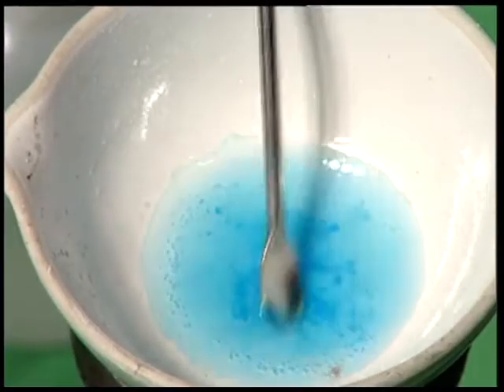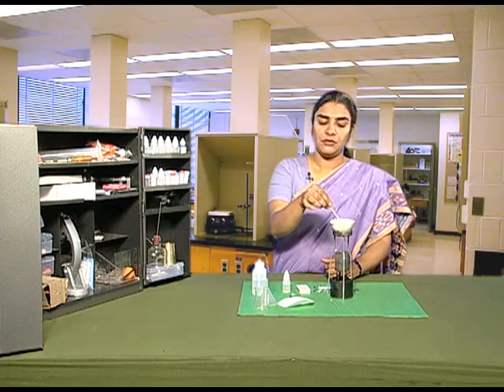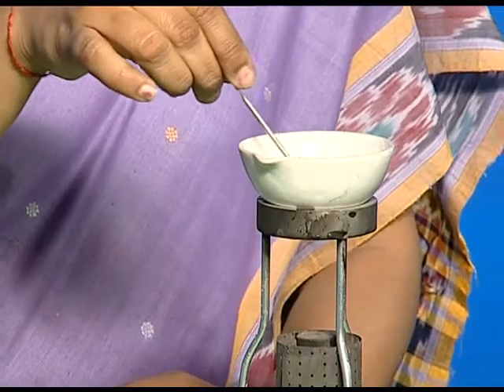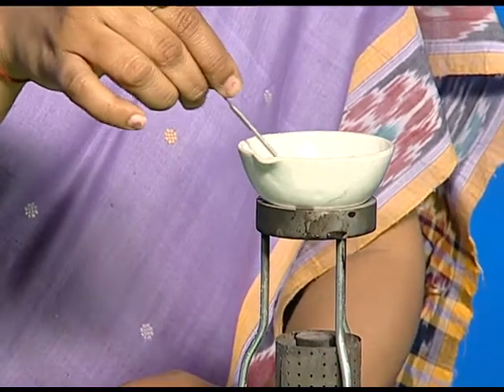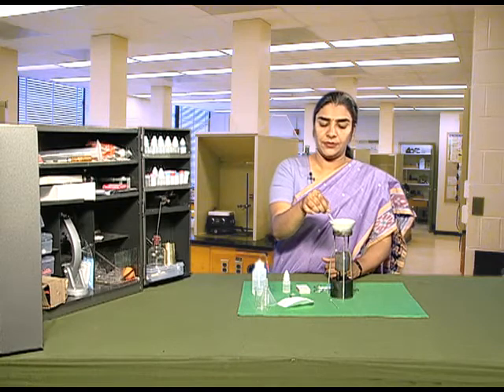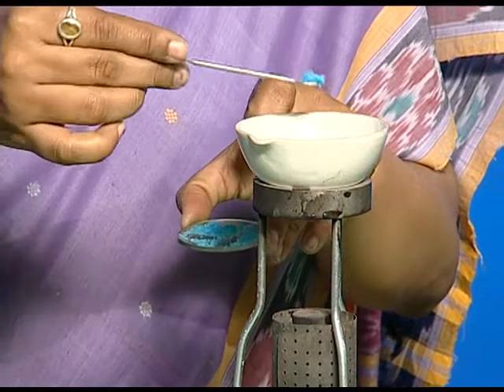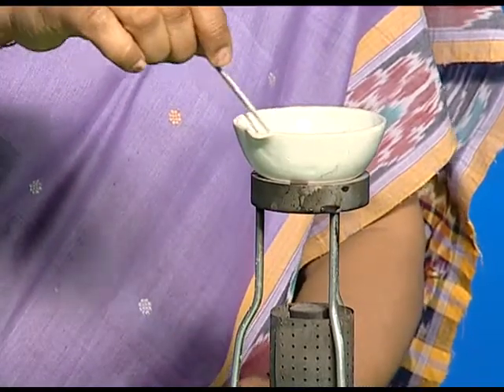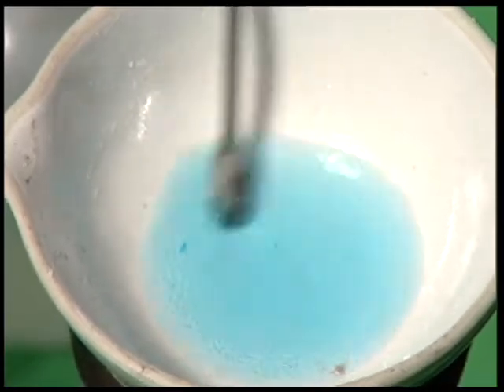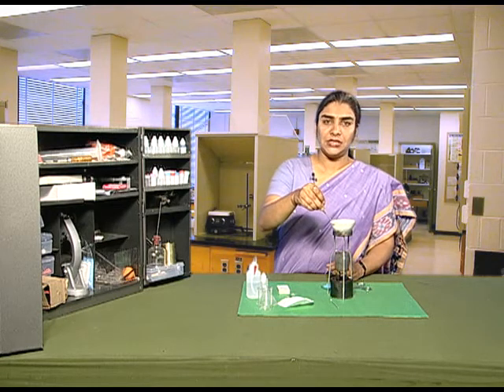Keep on adding copper sulphate powder to the solution till you get a saturated solution. That means, to the same volume of water, when you add more amount of copper sulphate, it does not get dissolved even when it is being heated. Keep on stirring the solution till it forms a saturated solution, which means no more copper sulphate can be added to the solution.